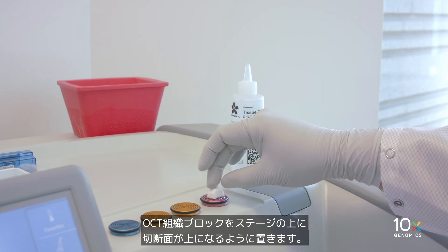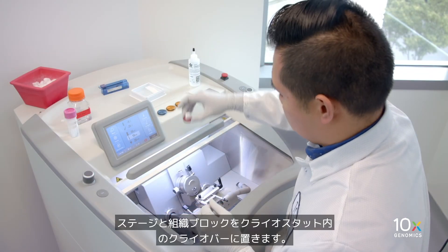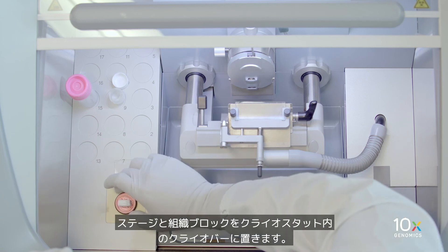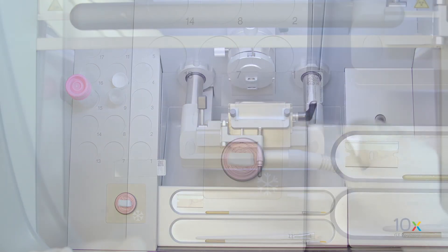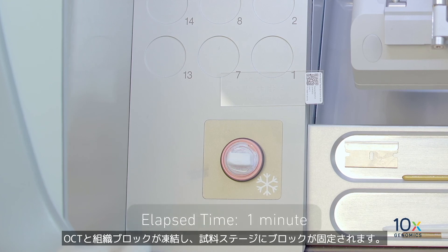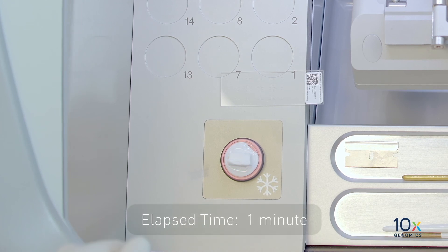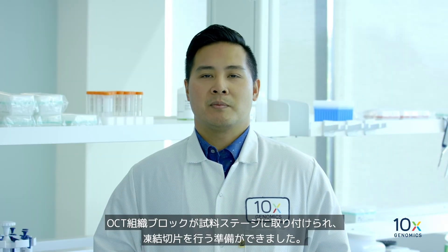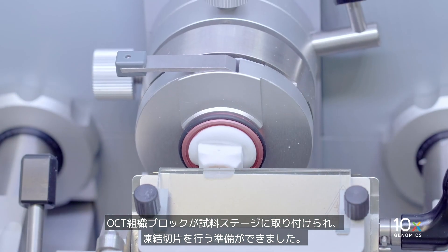Place the OCT embedded tissue block on the stage with the cutting surface facing away from the stage. Place the stage and the tissue block on the cryo bar inside the cryostat chamber. Allow the OCT and the tissue block to freeze and adhere to the specimen stage. The OCT embedded tissue block has been mounted on the specimen stage and now we're ready to cryo section.